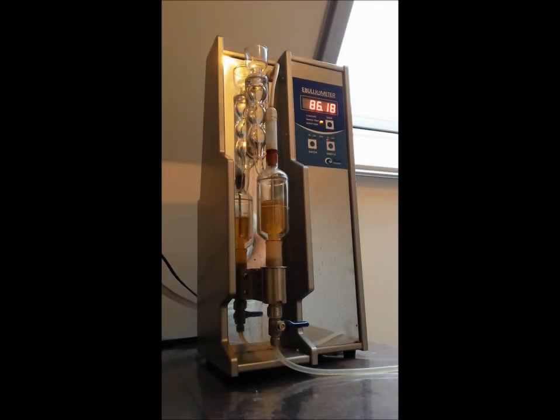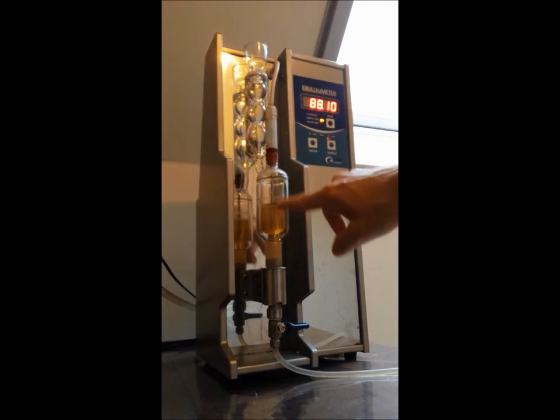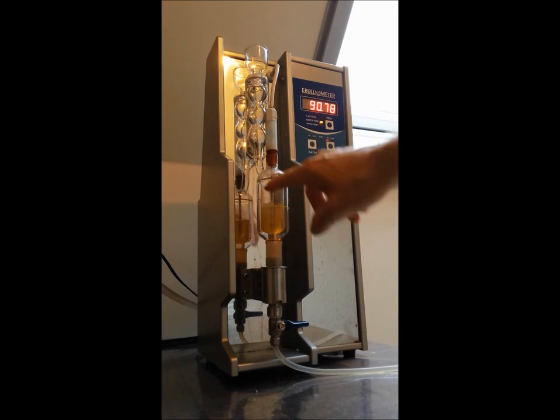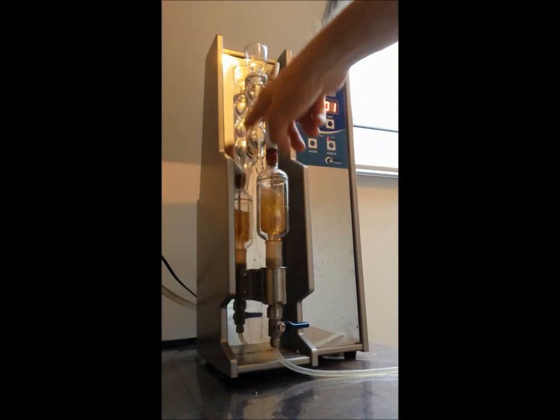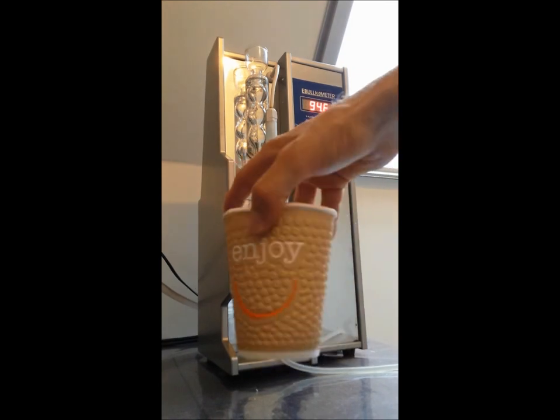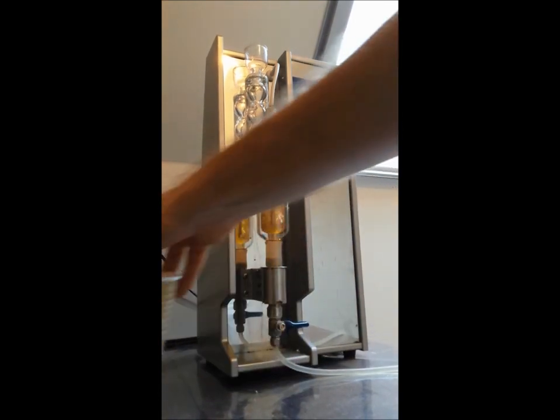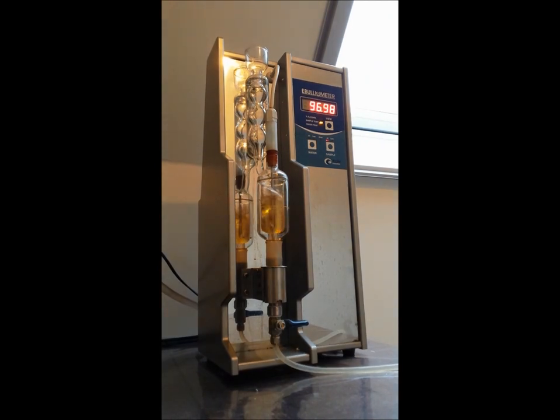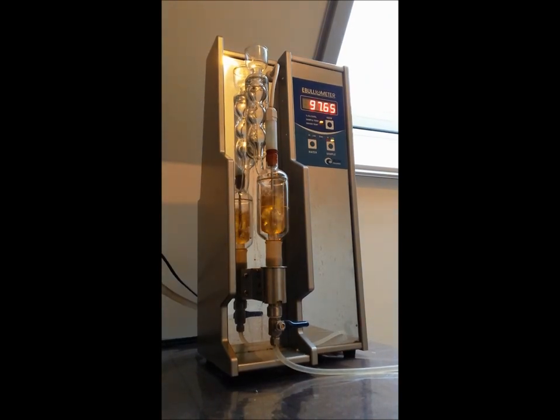The boiling process is very stable, it's very nice. No foam is being formed in the reactor, very different than before. So no foam in the reactor and of course then no foam in the condenser here. Just add the beer to a cup and add just one or two drops of the foam breaker and stir. Mix gently with some small spoon or something inside.